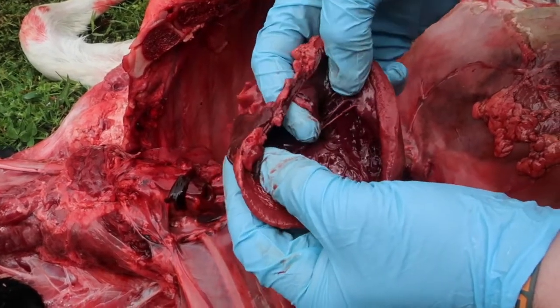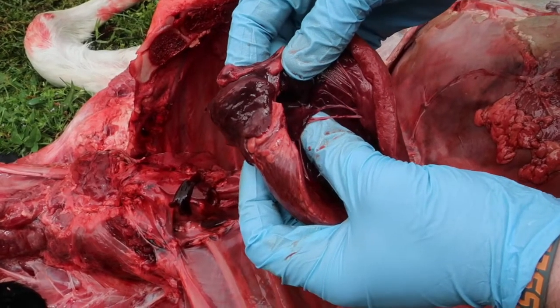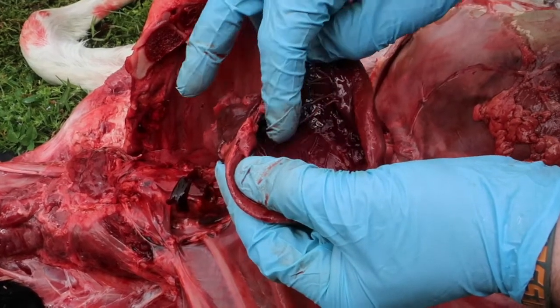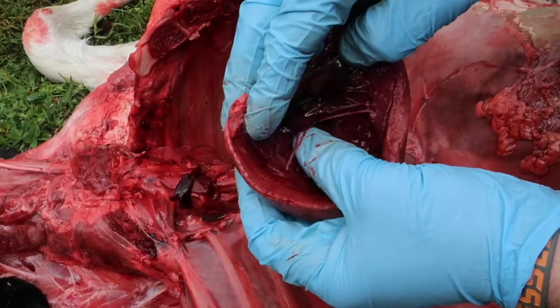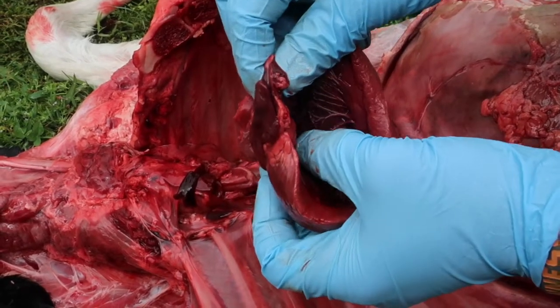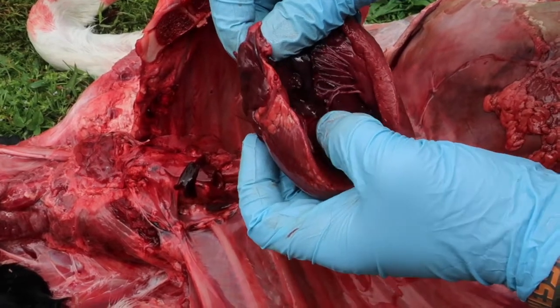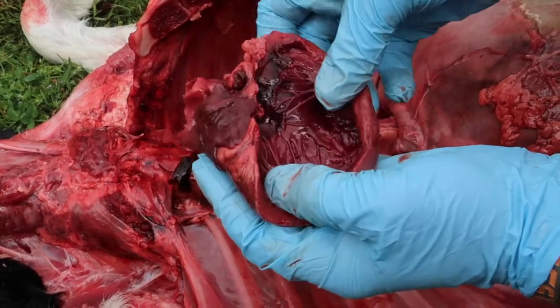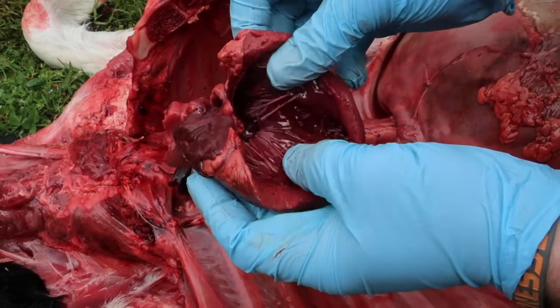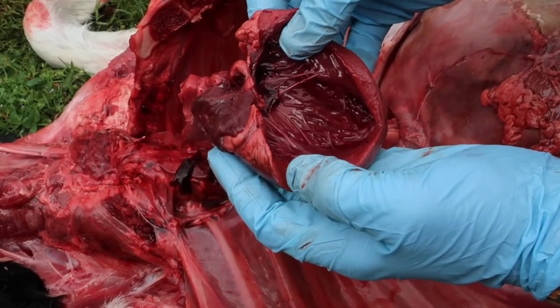It's going to flow from the atrium down through this valve called the right AV valve. And that valve is held in place by what are called chordae tendineae, these little string-like structures here. Once blood flows from the atrium into the ventricle, they help to block the backflow of blood back into the atrium. So blood will enter into this right side here, into the right ventricle, and then will be pumped to the lungs to receive oxygen again.